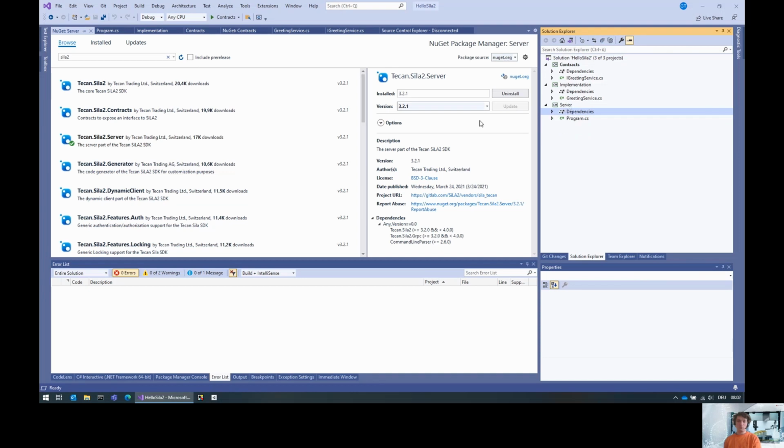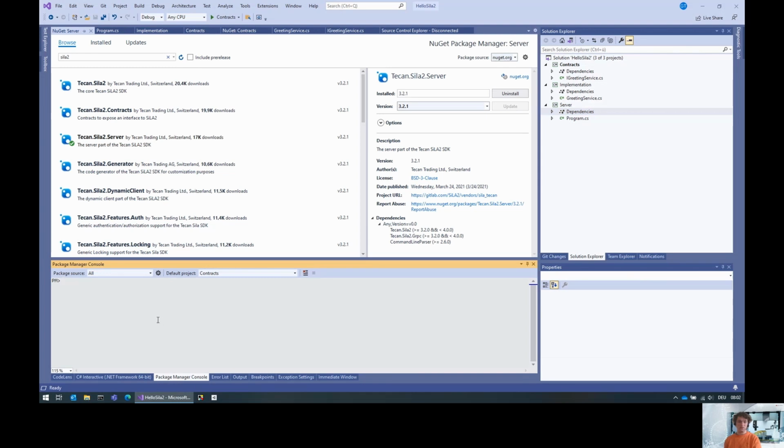What we use this for is that we can have the code generator, and the code generator integrates into the package manager console. It is a tool that is deployed together with the tecan.sila2 NuGet package, which we installed now. This tool integrates itself into the package manager console, so we can execute it from here, calling just SiLA-gen.